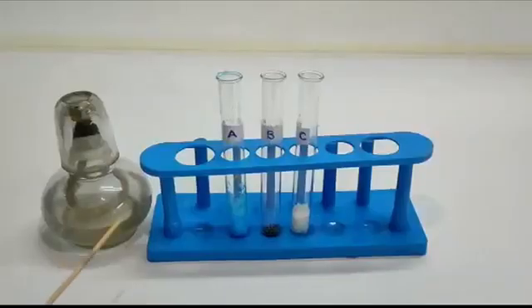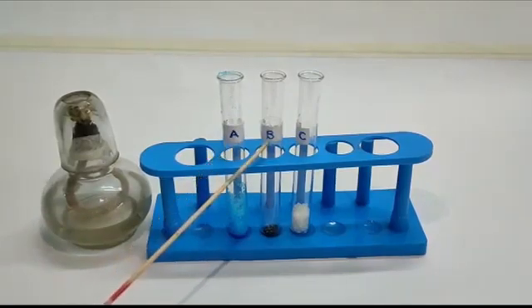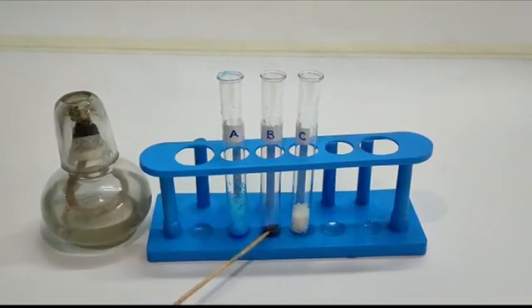In these apparatus, Test Tube A contains Copper Sulphate, Test Tube B contains Iodine, and Test Tube C has Sugar.